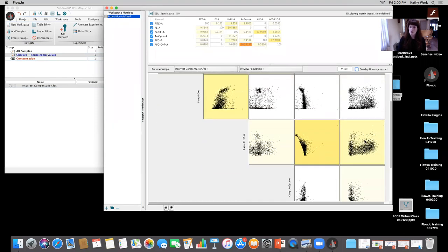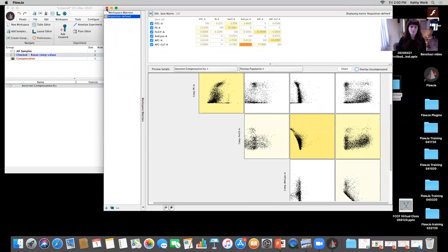And this is an example from when someone was adamant, "I can just reuse my old comp. It's fine. It doesn't matter." Okay, so I want to show you why it actually does matter.